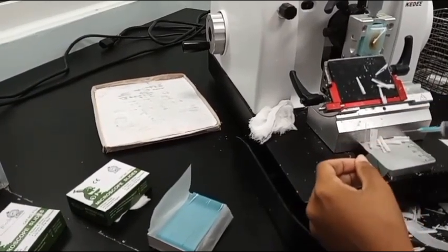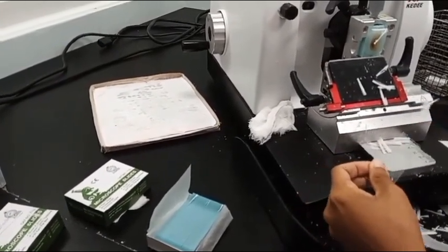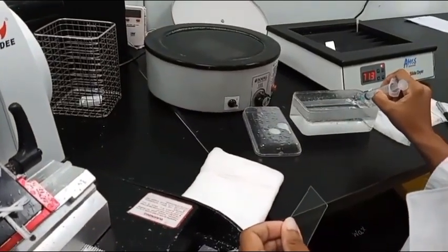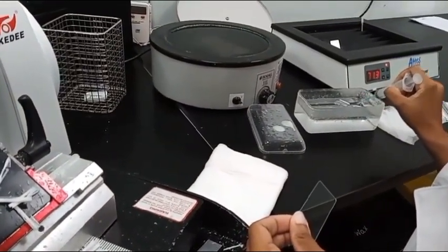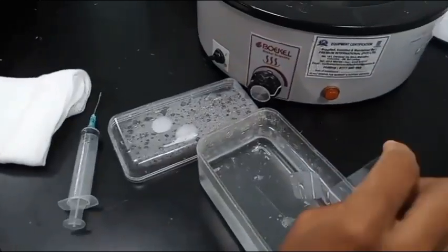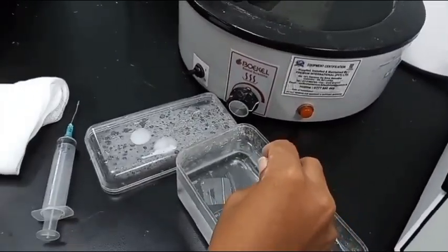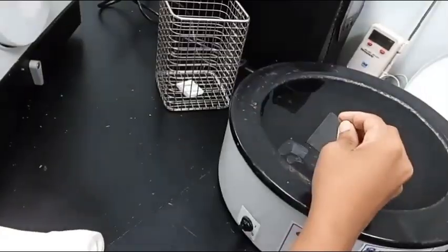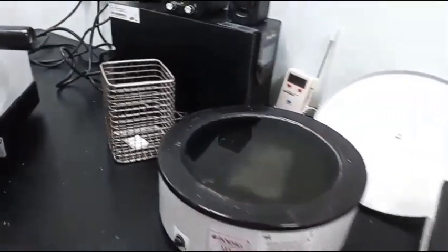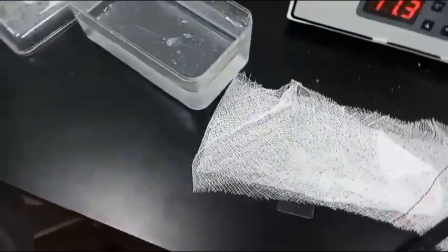This section is then put into a 30% alcohol bath. This removes wrinkles that may have occurred on the tissue section. Subsequently, the tissue section is transferred into the water bath and onto a standard plain glass slide. The slide is labeled using a diamond pencil. The slides are then placed vertically on a slide warmer to drain the water and then to melt the wax, temperature about 65 degrees Celsius, prior to staining.